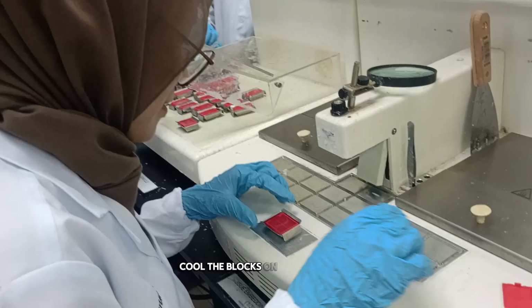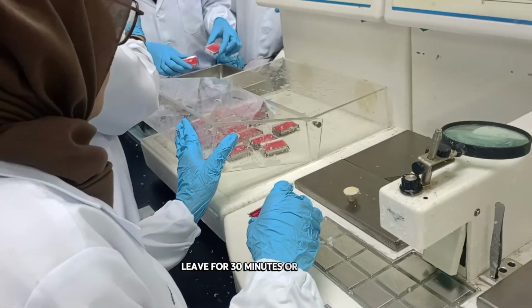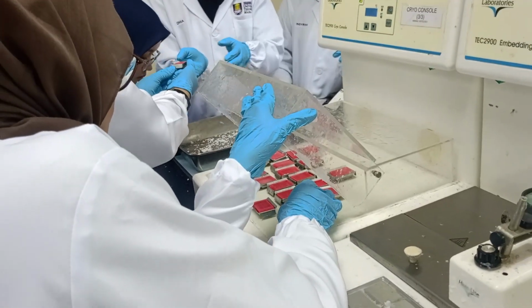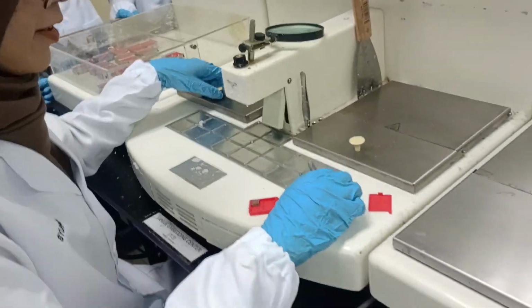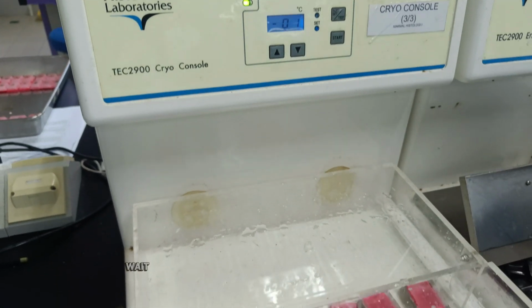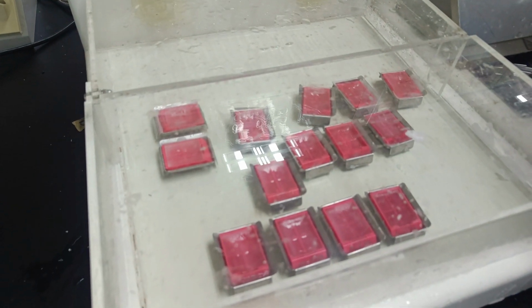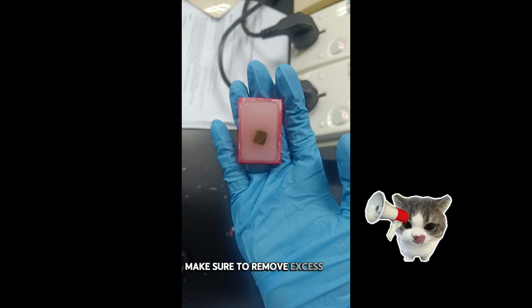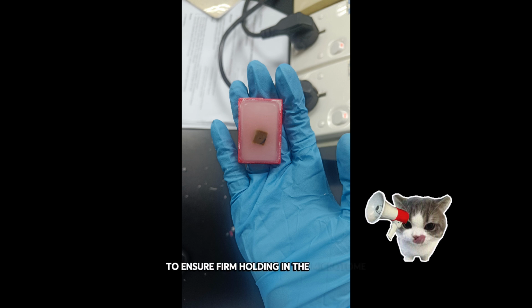Cool the blocks on the cold plate. Leave for 30 minutes or until cast. Wait until the cassettes are ready to remove from the mold. Make sure to remove excess wax from the outside of the cassettes to ensure firm holding in the microtome.